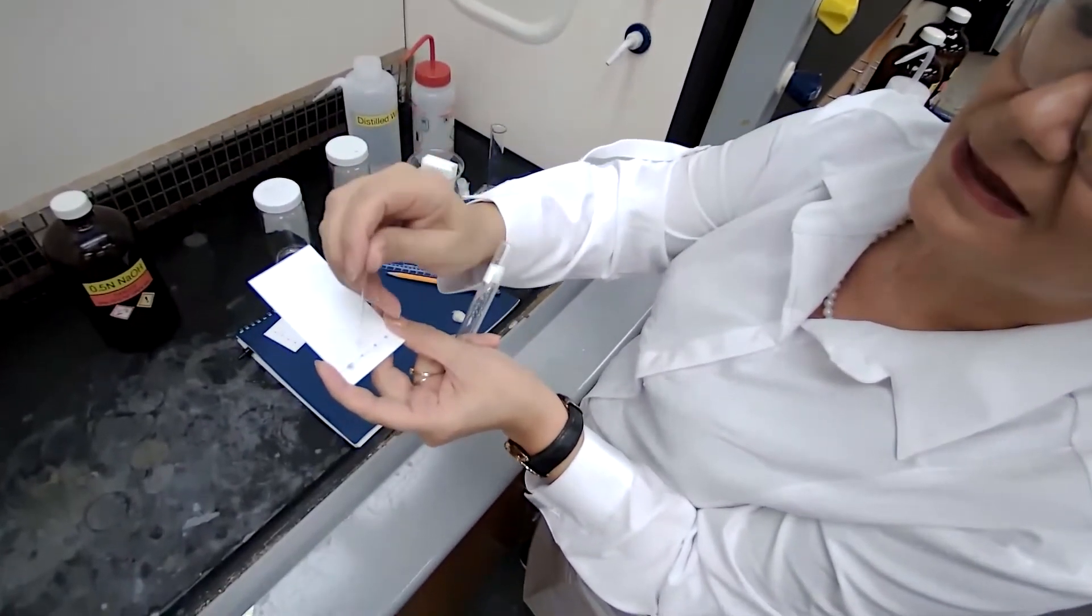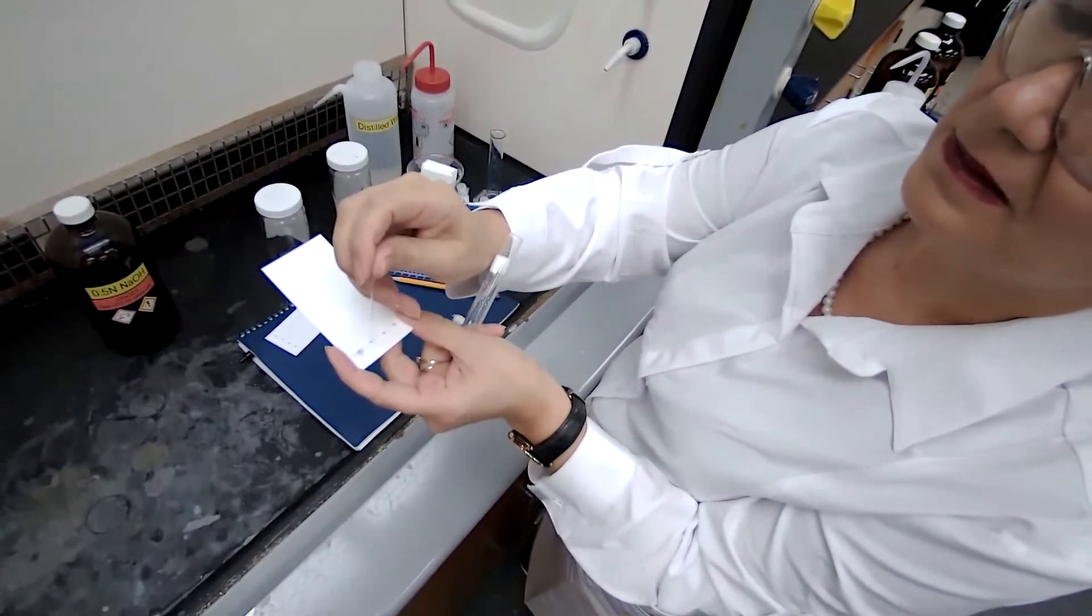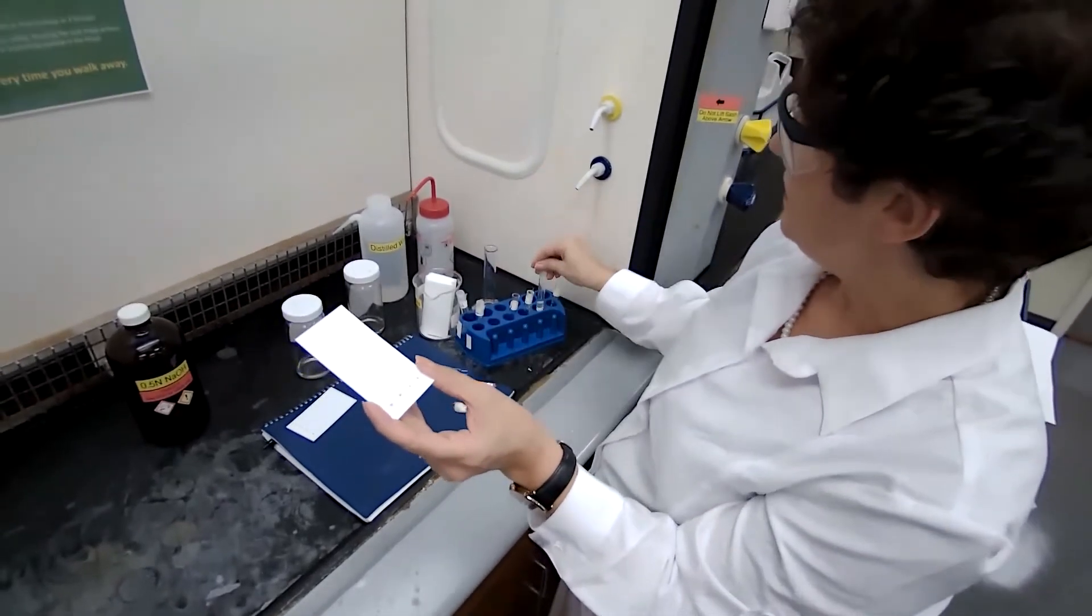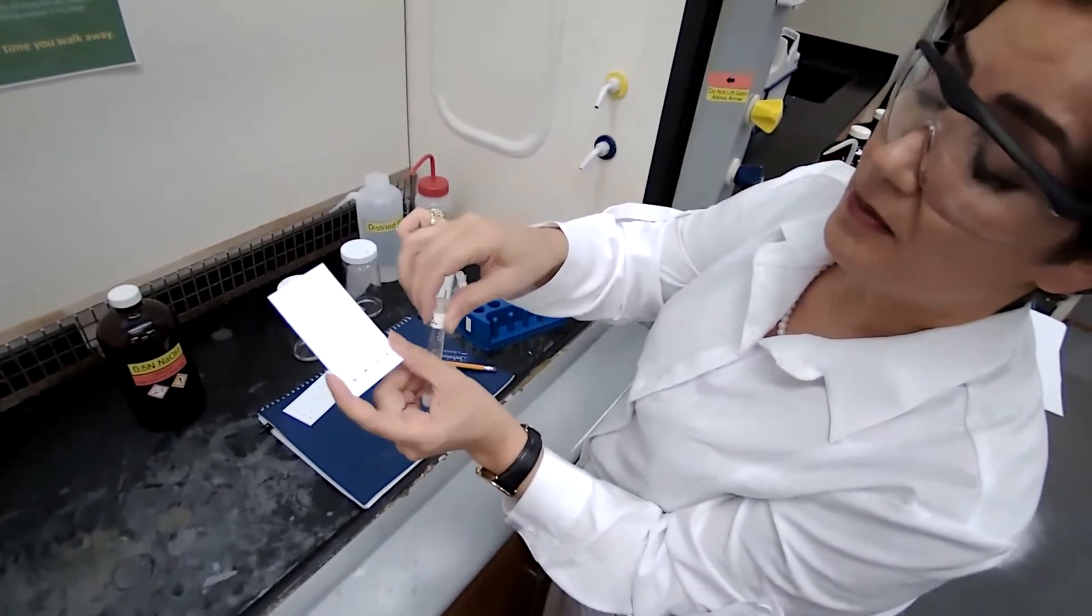Two is acetylsalicylic acid. You don't have to hold it, I'm only holding it up because of the camera.